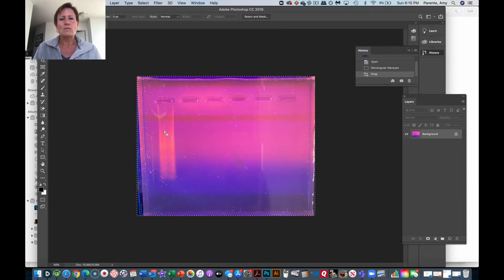And then one of the things that's often done with gel images is they're made to be black and white. That just helps with photo reproduction if you can make sure that everything's black and white. And then also sometimes you might want to invert the image. So with the gel images we have here with agarose, where we're looking at DNA, the DNA is lighter than the background, and that's because it's fluorescing because of the ethidium bromide that we had there.